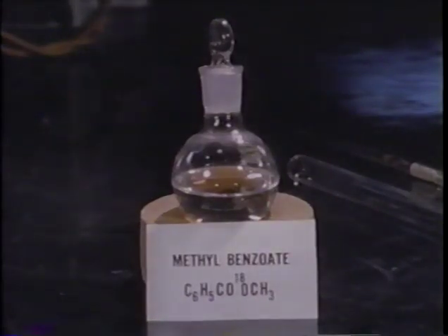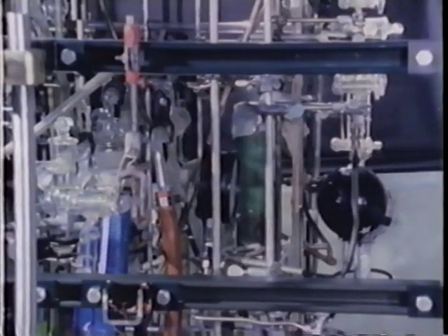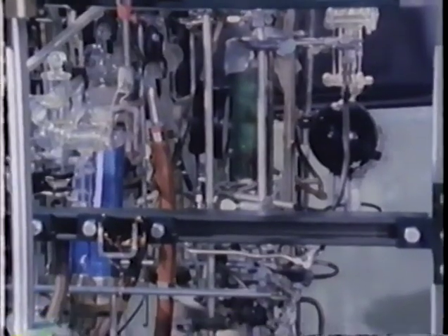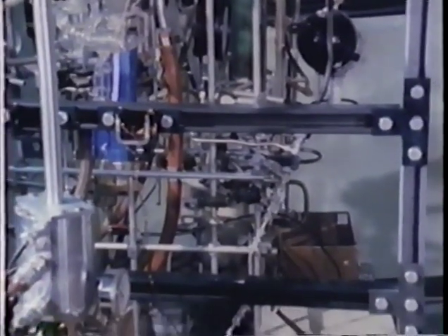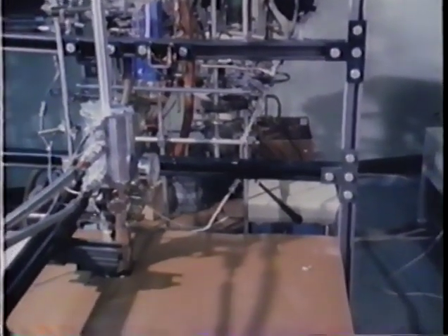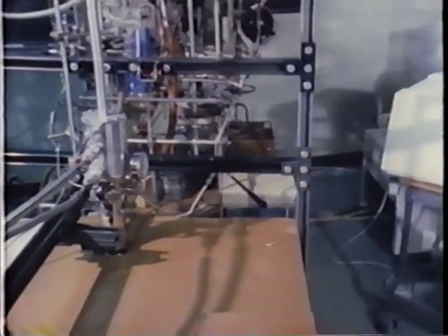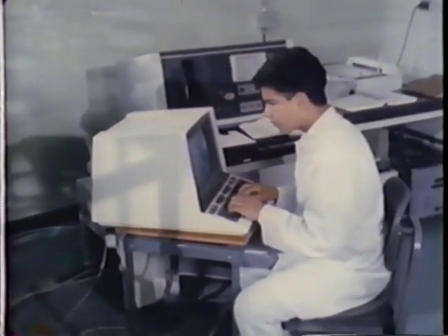Now let's check the presumably labeled ester. We use a mass spectrometer which can handle molecules of heavier mass than we've used so far. The ester has been placed directly into the mass spectrometer. The large ester molecule will break into many smaller fragments, but we shall find them easy to identify.